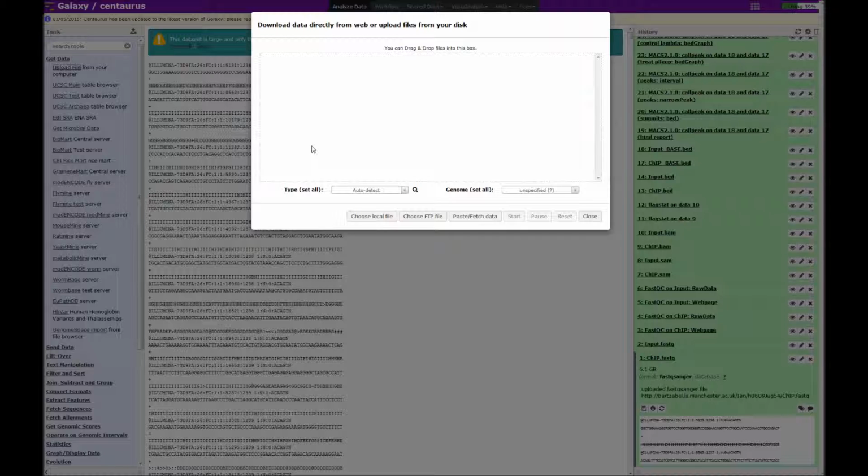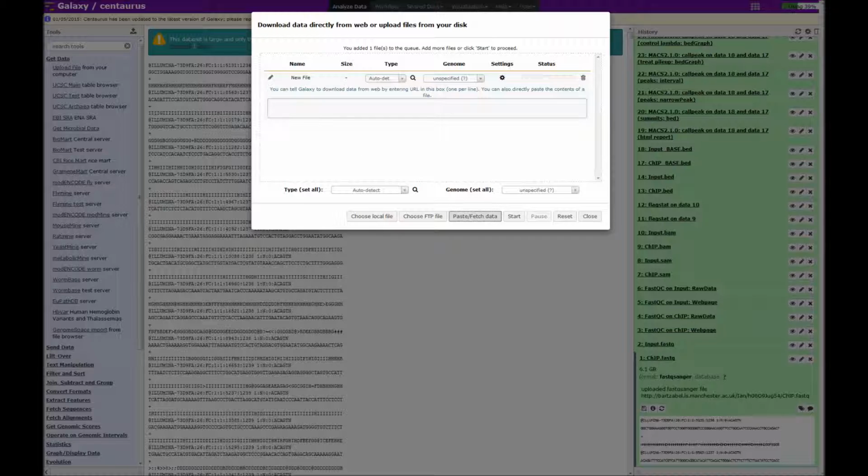Now, in this section you can either drag files from your computer into this area and that will prepare them for upload. However, you can also choose to upload files from a web server with a URL, and you can do that here by clicking on the paste fetch data button. So if you have the URL for your web server, you can just type it in here. At the same time, you can also tell Galaxy what type of file it is, although it will try to guess what the file is by looking at the file itself.